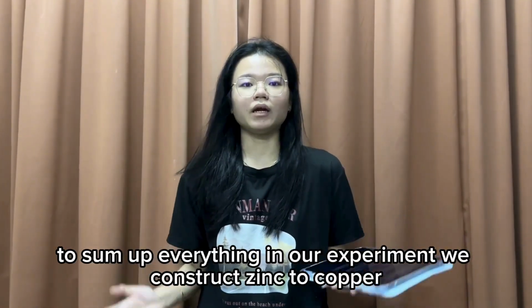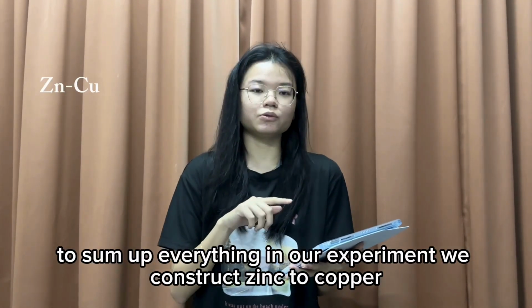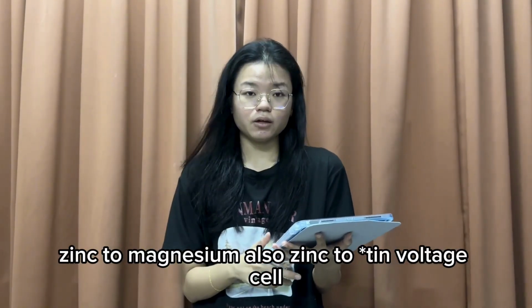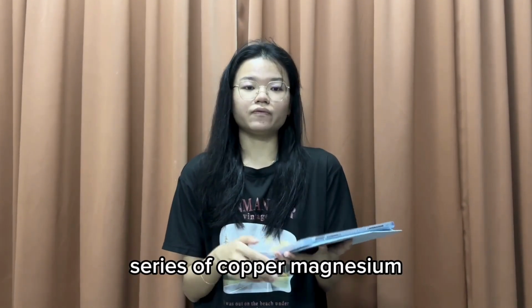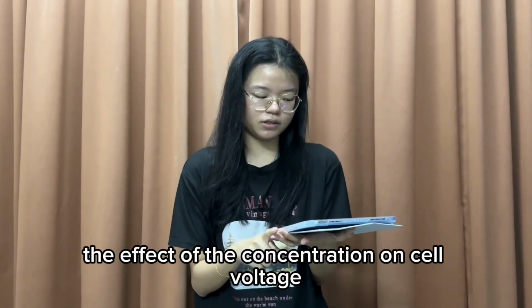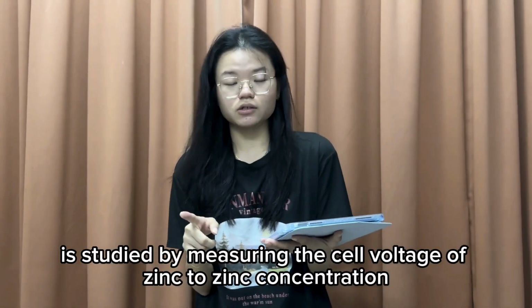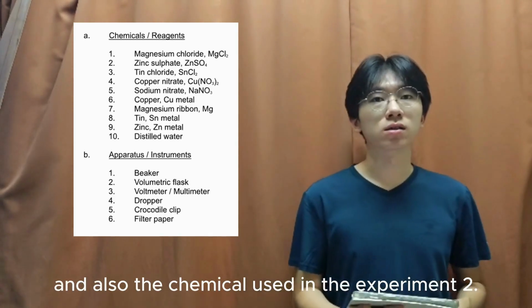To sum up, in our experiment we construct zinc-copper, zinc-magnesium, and zinc-tin voltaic cells, and measure the cell voltage to determine the activity series of the copper, magnesium, zinc, and tin metals. The effect of concentration on cell voltage is studied by measuring the cell voltage of zinc to zinc concentration cells. Now I'm going to explain the apparatus and the chemicals used in experiment 2.